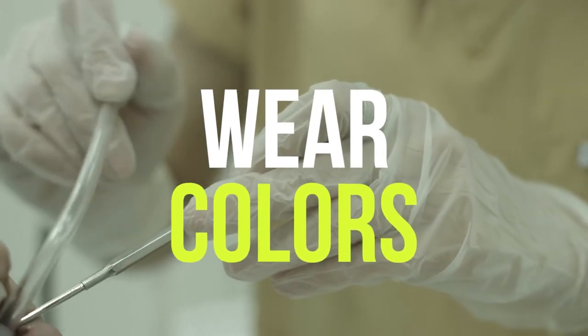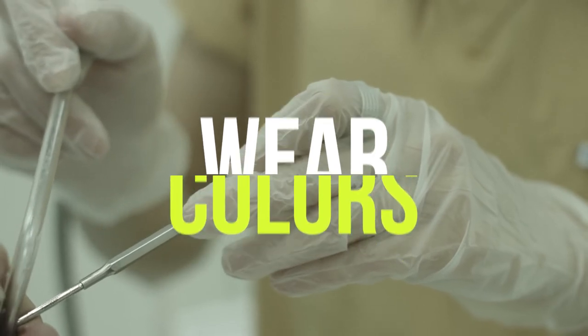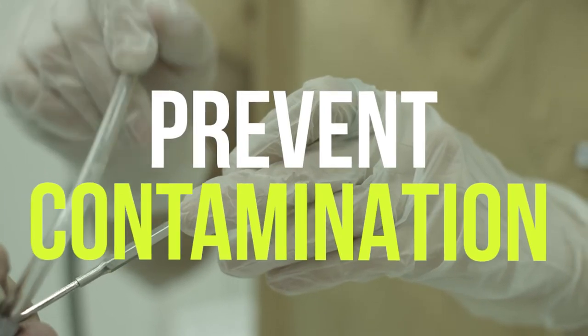Caution! Always wear a pair of gloves if you use a microscope to prevent contamination.